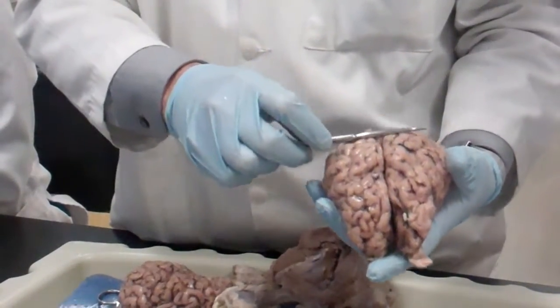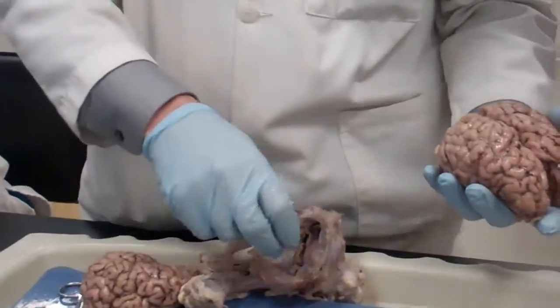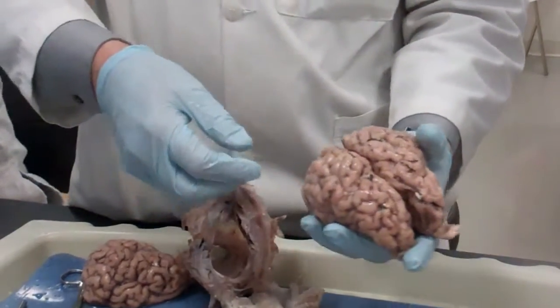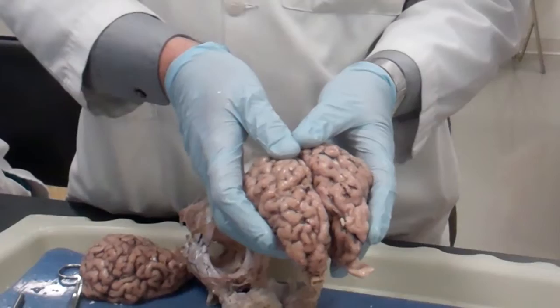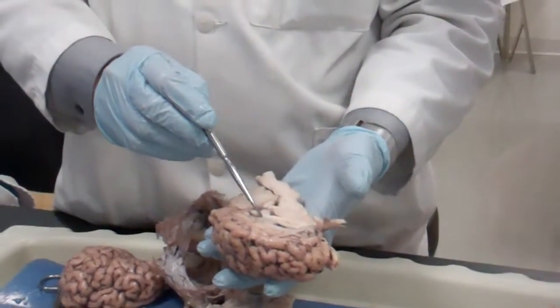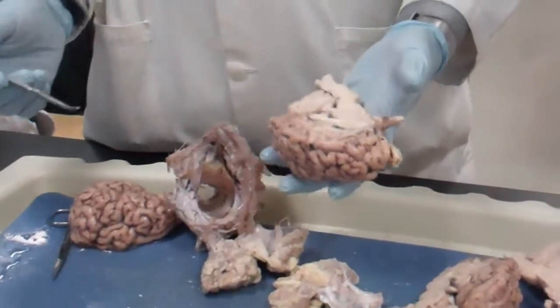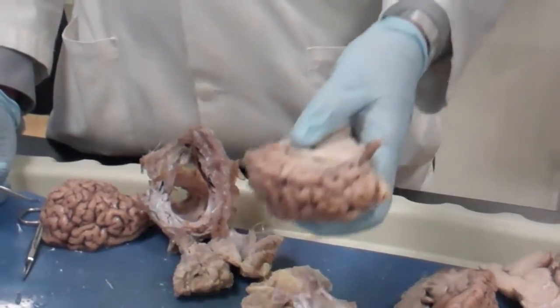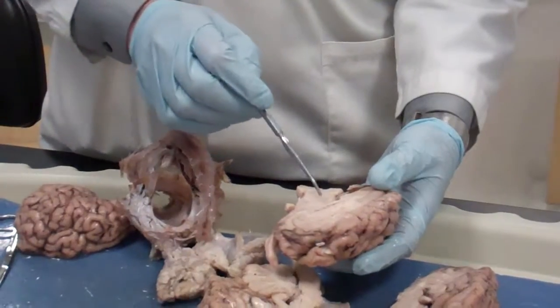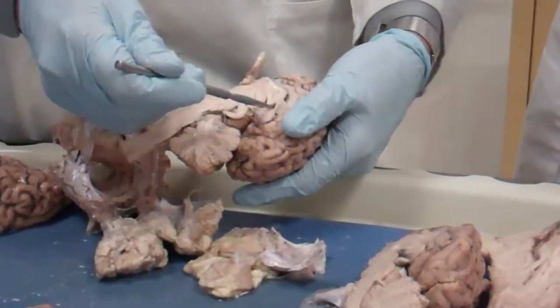Frontal lobe, parietal lobe, occipital lobe, temporal lobe. Longitudinal sulcus — technically, this is where the falx cerebri sits. Now, if you separate the brain into two, you will see that we are cutting through the corpus callosum. It's white, and it connects the two cerebral hemispheres. When you cut on one side, one side will be without and one side will be with the septum pellucidum, which is right there. So you see the lateral ventricle, and the other side has the septum pellucidum.